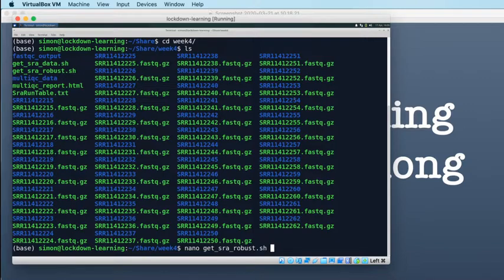Then I compared the size of the SRA file that I downloaded with the size in the table, and they were very slightly different to each other, which is frustrating to say the least. So any check that I could implement for the file size in the table versus the file size downloaded from the SRA would not work.